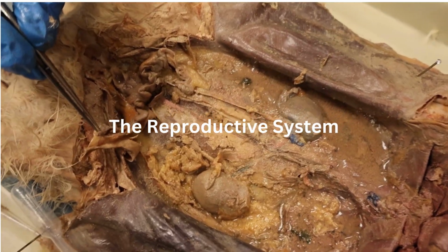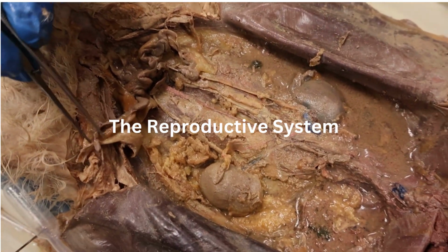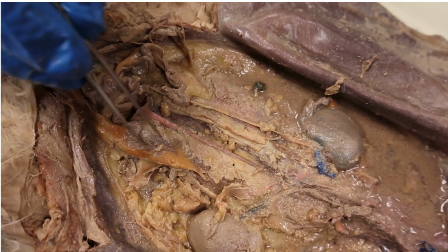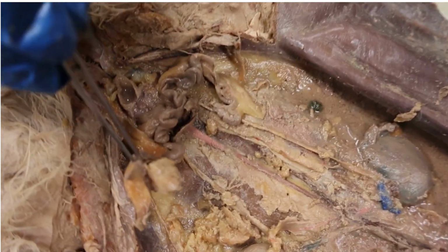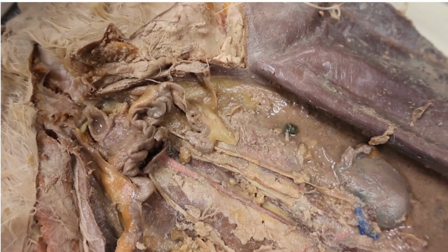So we're starting the reproductive system of a rabbit, and this is a female rabbit, and it has female gonads. As you can see, it has the ovaries, the fallopian tubes, and then the uterus. The ovaries is where the eggs are held, and then it travels through the fallopian tubes to get to the uterus where the baby is made.